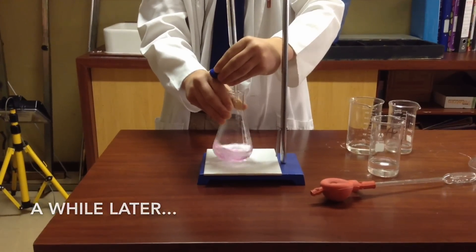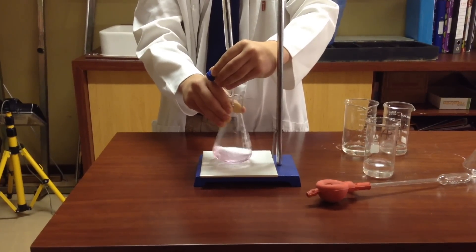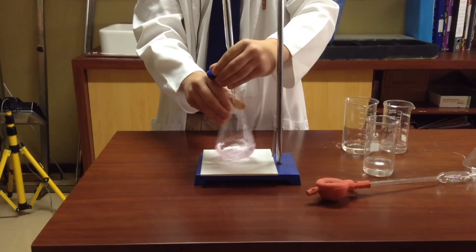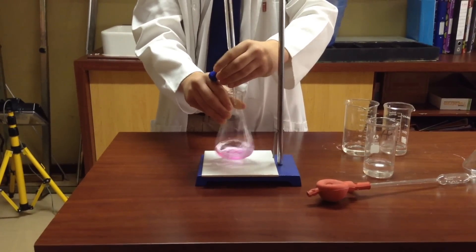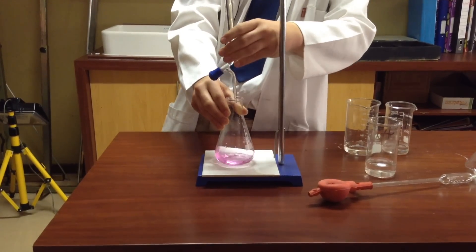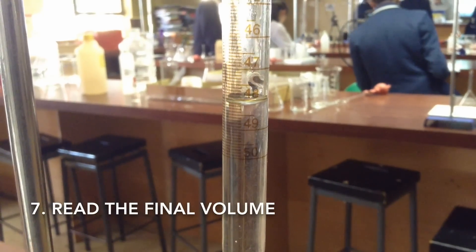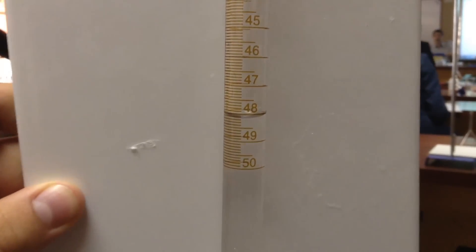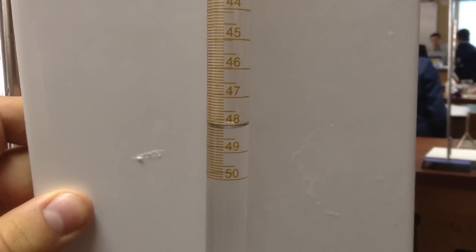So you want the rosy pink to stay. Okay, there we go - we're done, and that's a titration. Okay, so once we've done our titration, now we need to get our final reading of the volume. So if we use the white tile, you level - remember two decimal places - so that's 48.18.